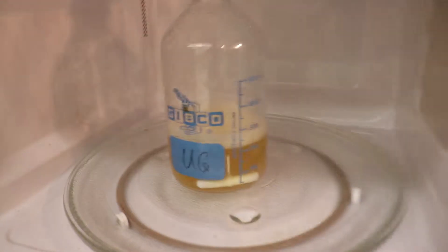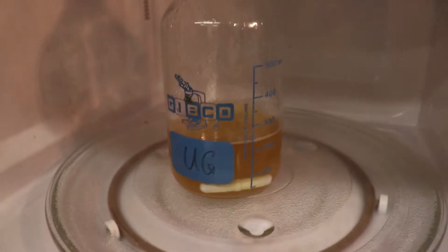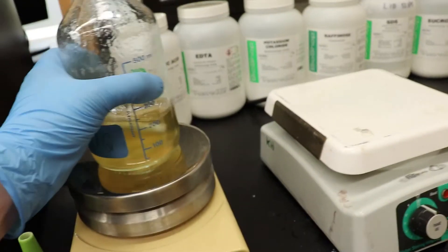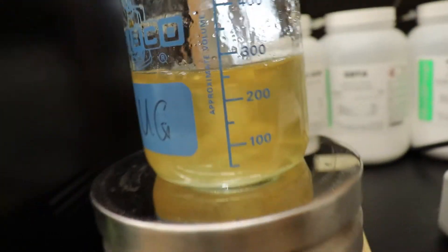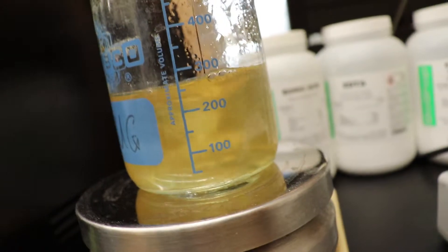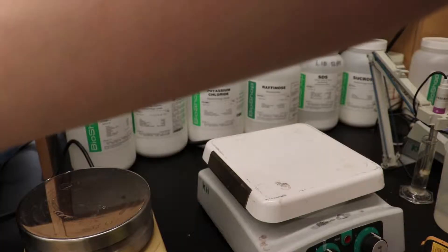All right, let's see if we can catch the moment when it just begins to boil. Cool. You see that? Stop now. Exciting stuff, guys. Exciting stuff. And as you can see, it's starting to get clearer and clearer.